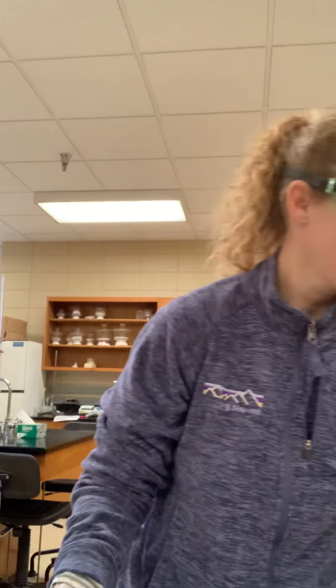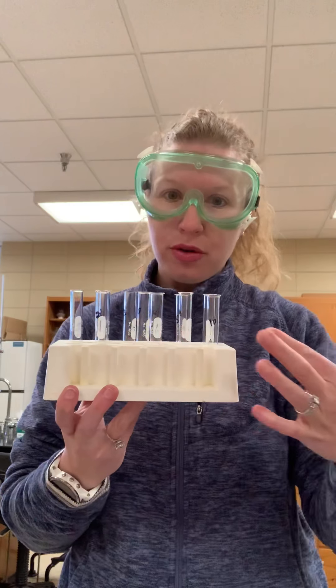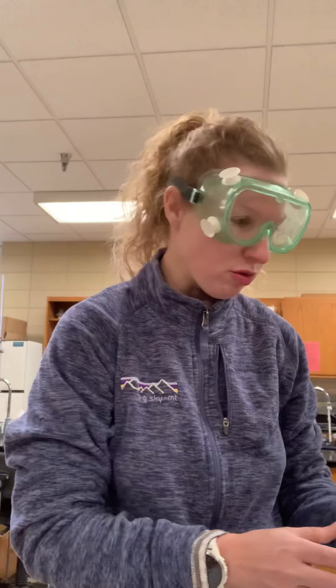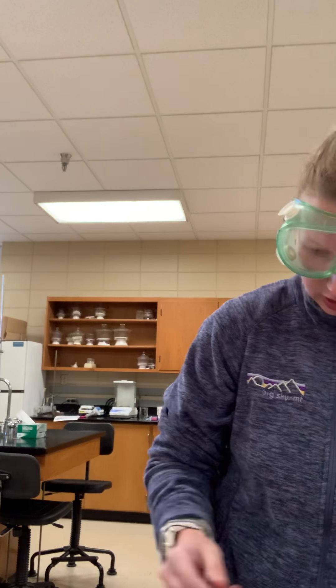Hey guys, here we are in the lab ready to start the qualitative analysis. If you have your procedure, I'll tell you some stuff I've already done. I already have my test tubes labeled 1 through 10 in my test tube rack, and the chart I had already made for you. I'm not going to be writing this down — that's something you need to be doing as we go along, so make sure you fill out your chart.